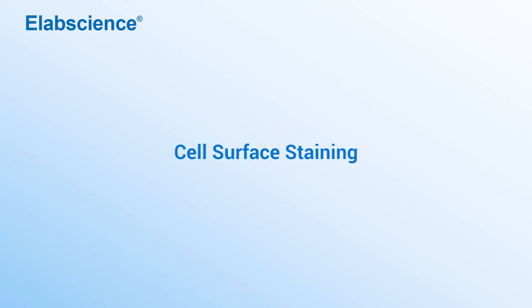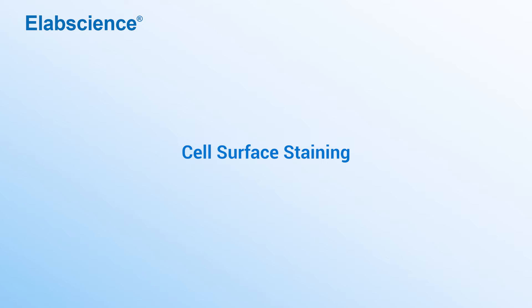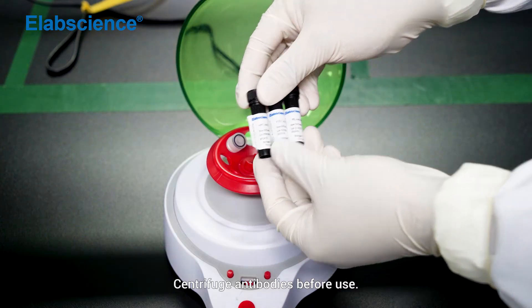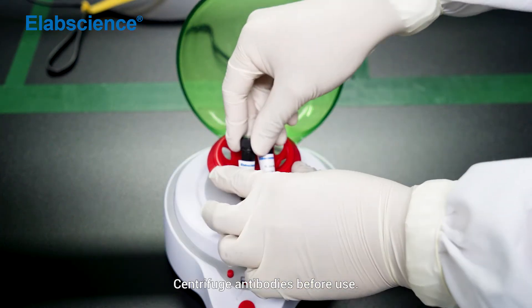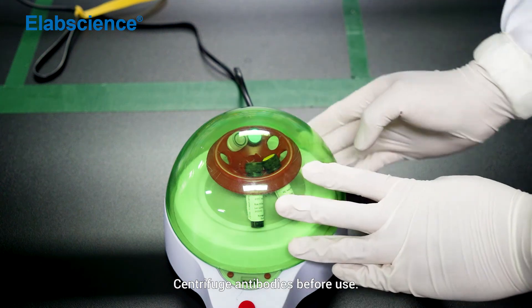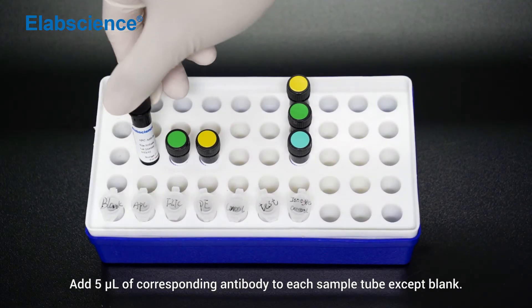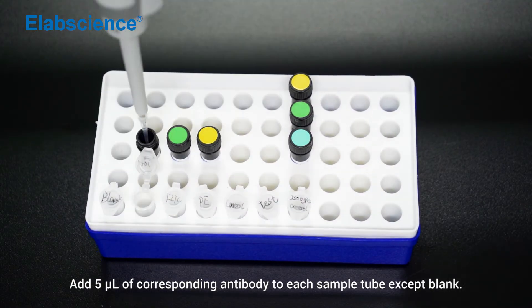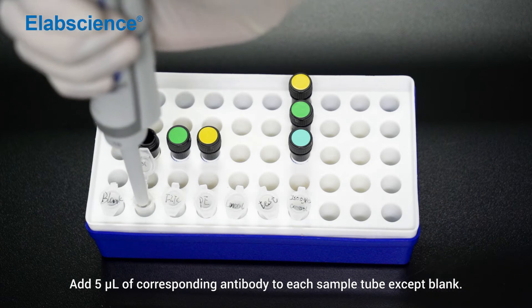Cell surface staining. Centrifuge antibodies before use. Add 5 µL of the corresponding antibody to each sample tube except the blank control tube.